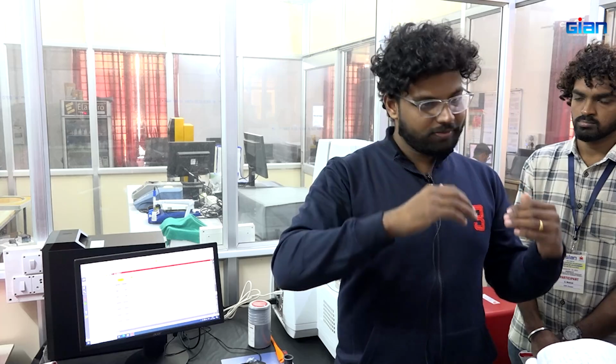Then what is the final viscosity? Final viscosity is the final one. Obviously first we will be heating, then we will be cooling. Finally after cooling we will reach one viscosity, right? That is nothing but the final viscosity. Gelatinization and pasting temperature, those things you will also know.